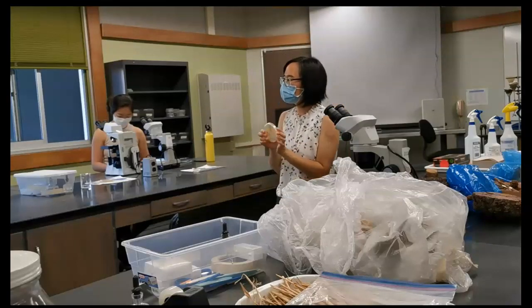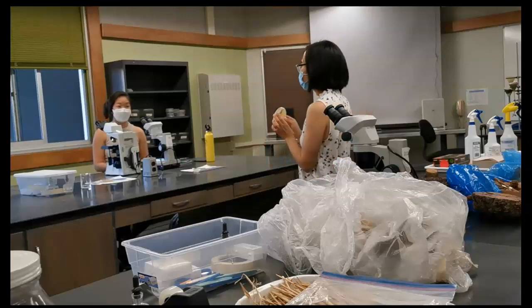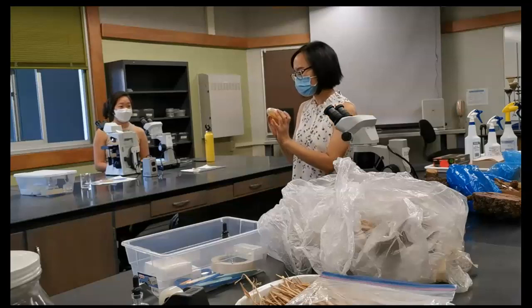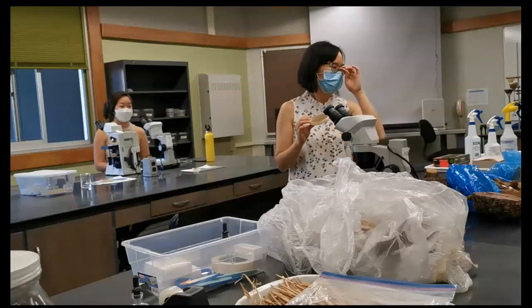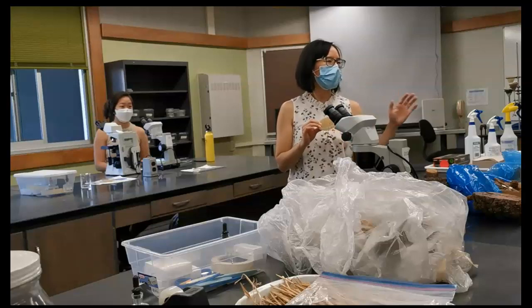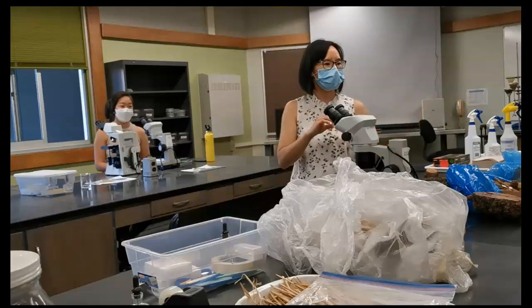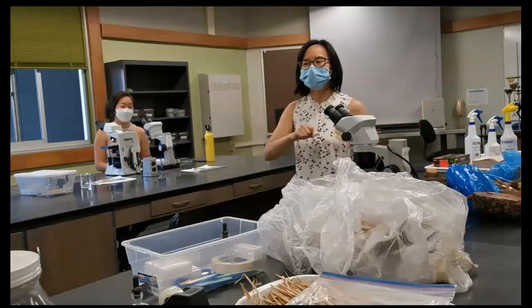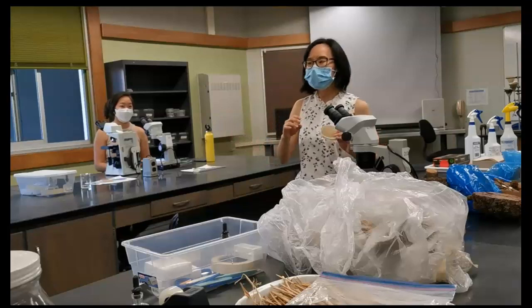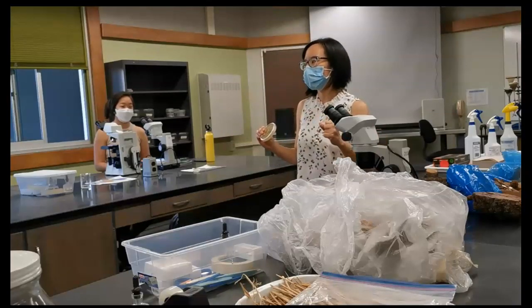What is the purpose of doing three-way streak? Remember? What is the purpose? Like different levels of pathogens. So like it's like most concentrated, and second most concentrated, and third most concentrated. You like spread it out. Right. So that's how we do three-way streak. So basically, three-way streak is like a diluting process, and then at the very beginning, you get the highest concentration.